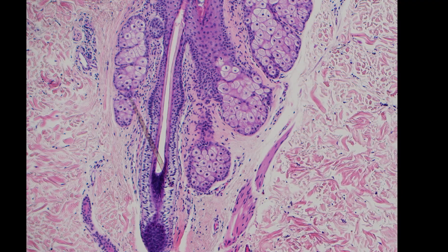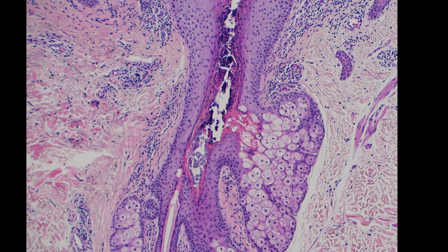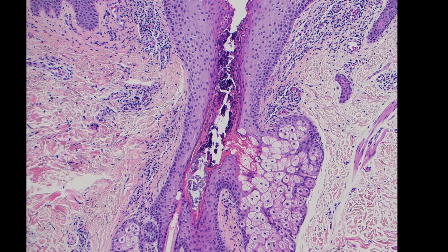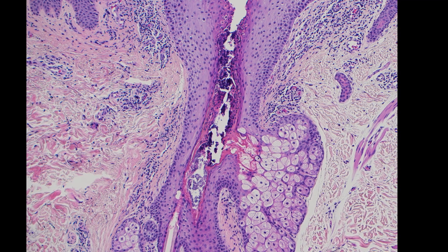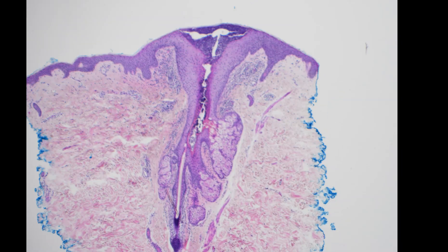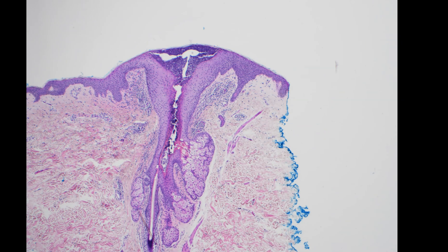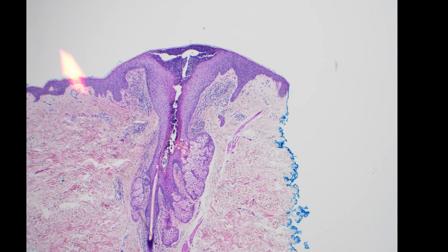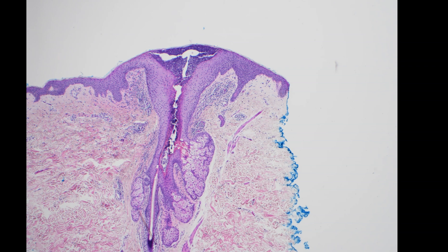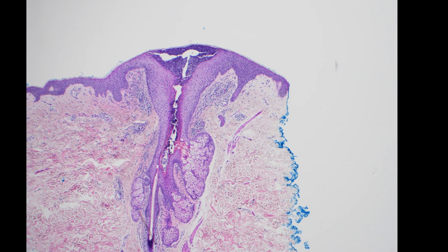But the reason I'm showing you this — that's just the normal hair histology, and I've got a video about that that I'll put a link to below if you need a refresher. But this follicle is not totally normal. It's filled with inflammation, neutrophils, and some grungy debris here.